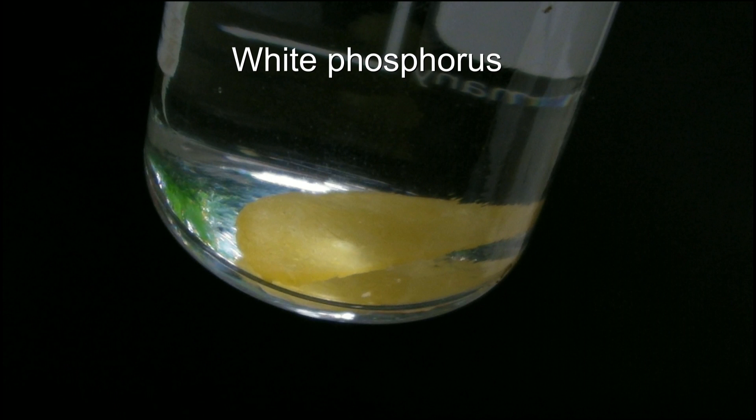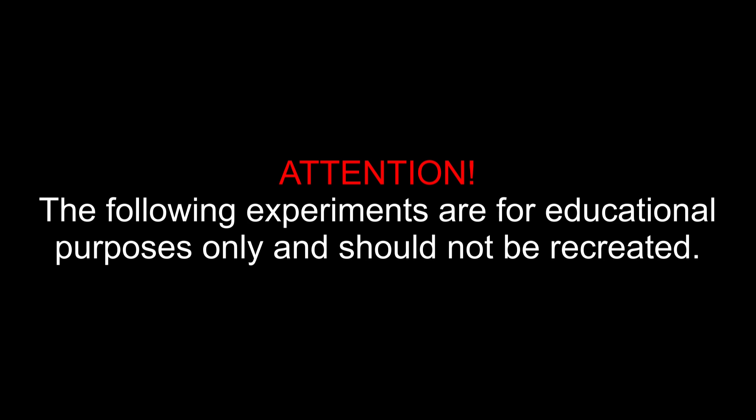White Phosphorus. Attention! The following experiments are for educational purposes only and should not be recreated.